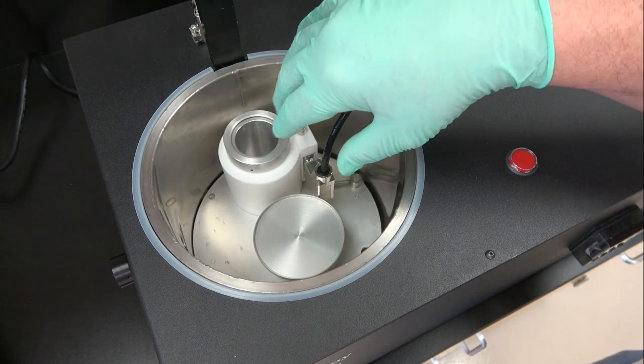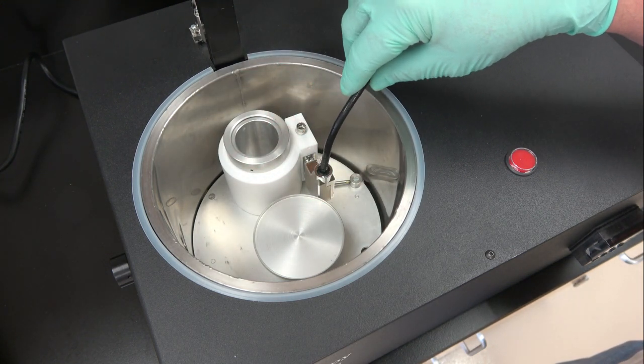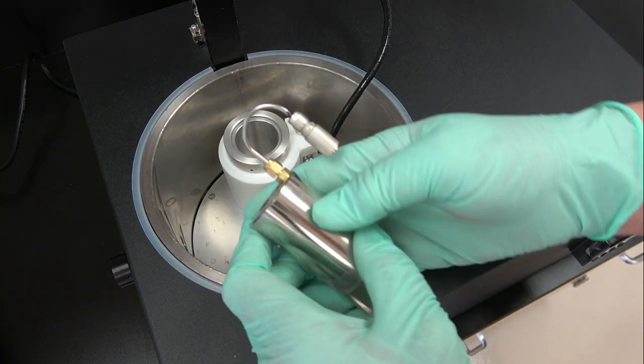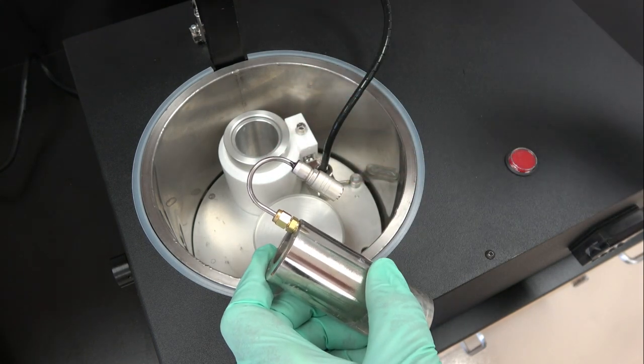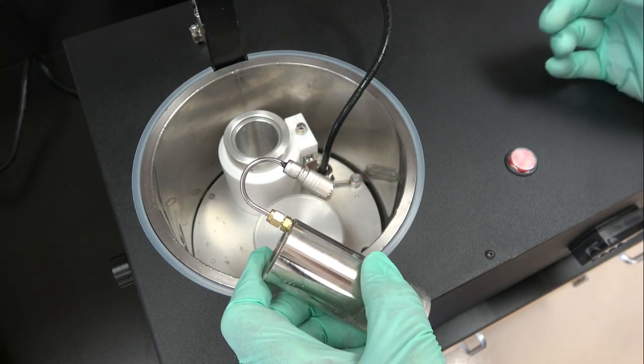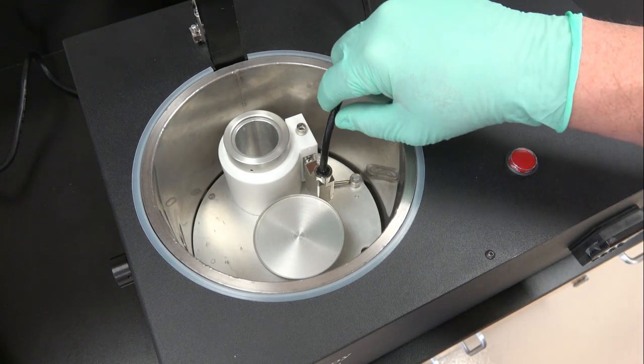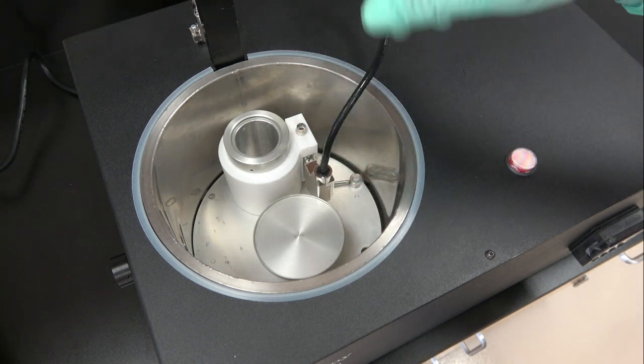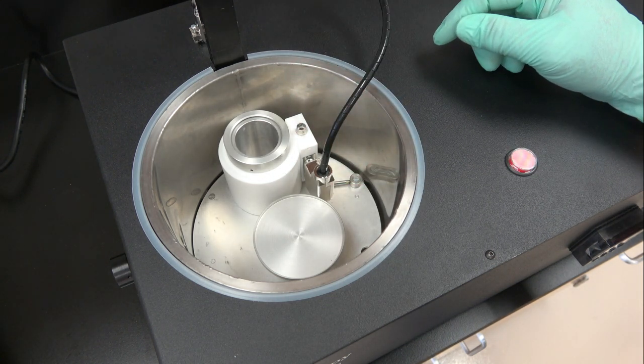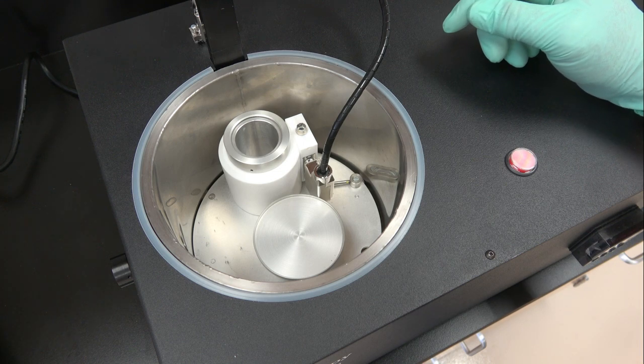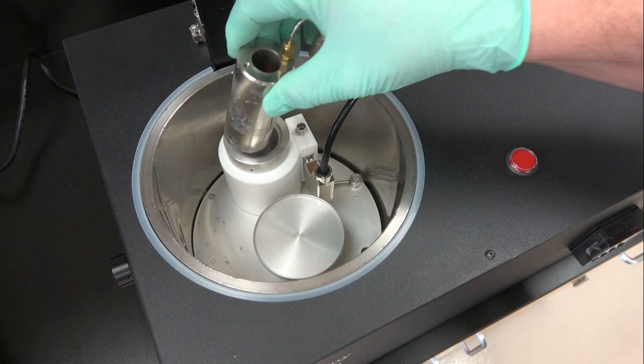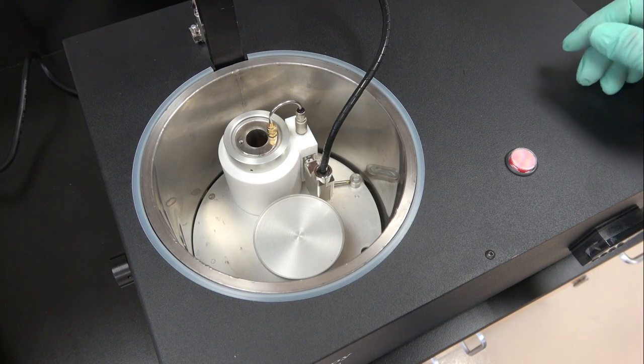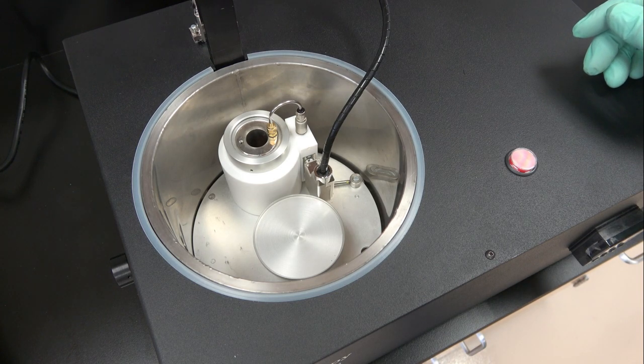Then the next morning you can dry everything off. Be careful not to manipulate the cables when cold. That's why I encased this in stainless steel so you can't easily break it. This is just some wires with some Teflon coating you can break. That's why it's a single piece that can be removed and replaced if it breaks. The next morning once everything's dry and you want to operate again, you just slide it in, make the electrical connection, and you're ready to resume work.